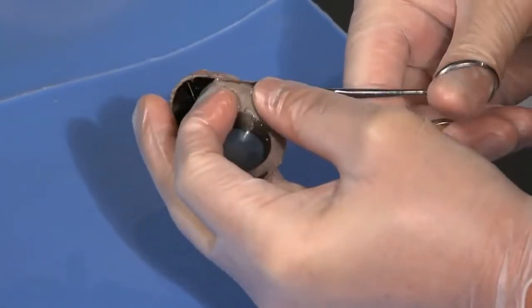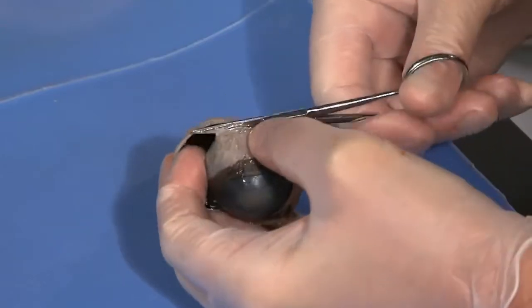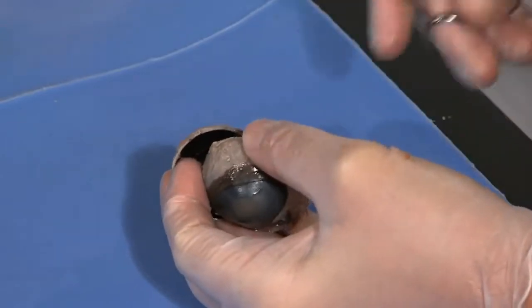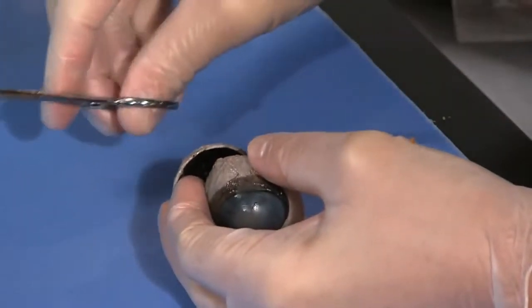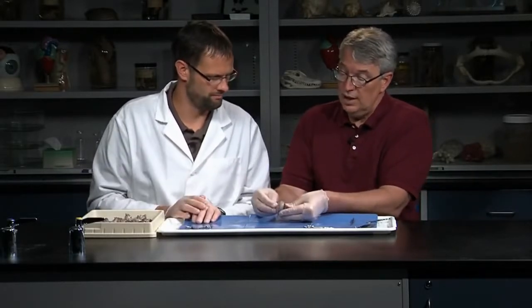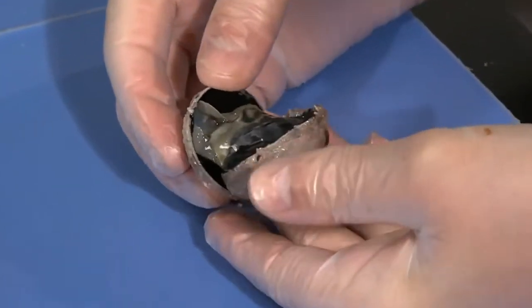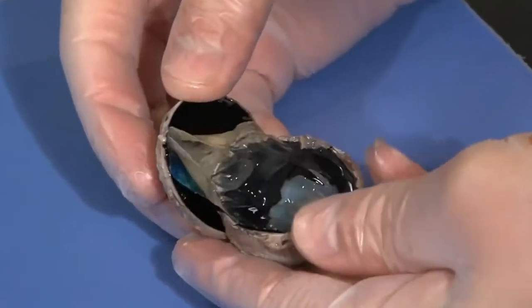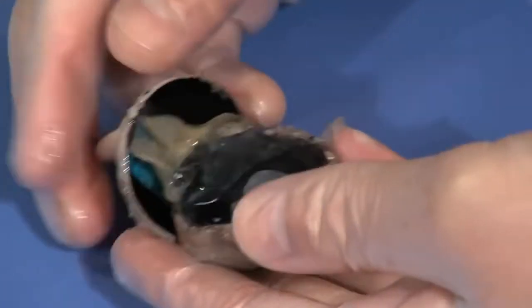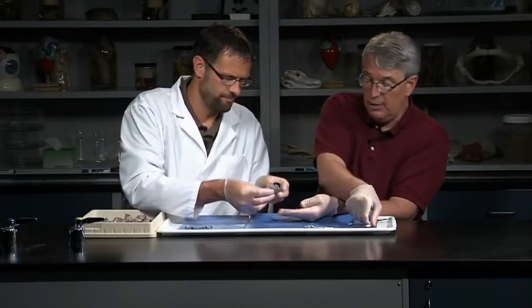We have some more information on this on the website too — there'll be photos and stuff that'll go along with this. So here things are. If you cut the eye and then just open it up like that, I'll use a pair of forceps here.